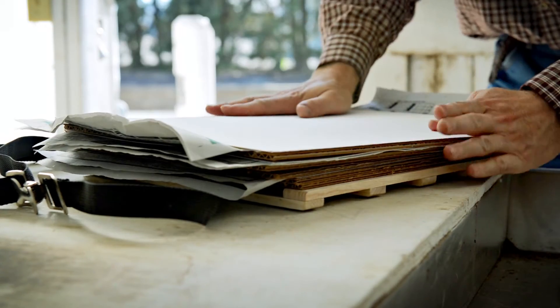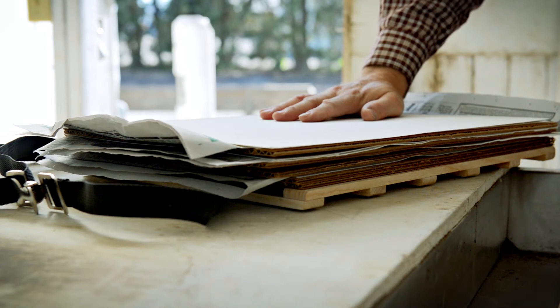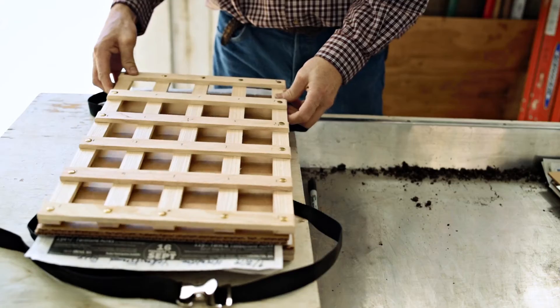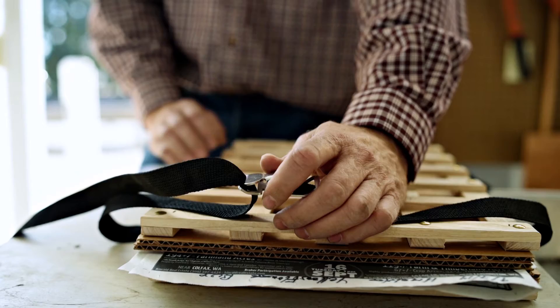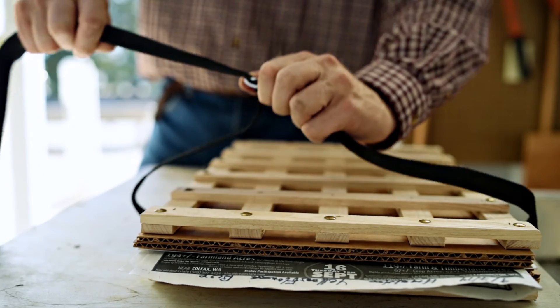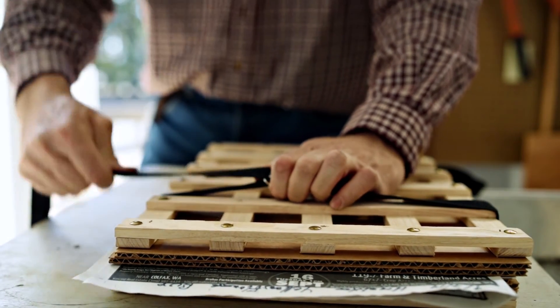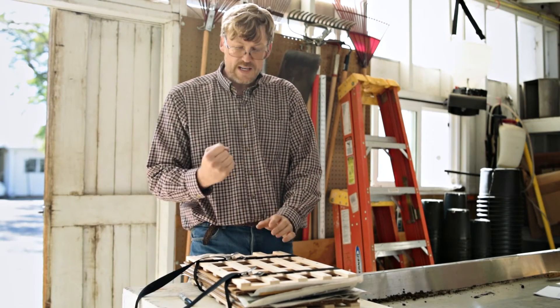On top, I like to have a couple pieces of cardboard, and of course the top slatted piece of wood to complete the press. Strap the straps around it to keep everything secured. This compresses the press to draw moisture out of the plants.